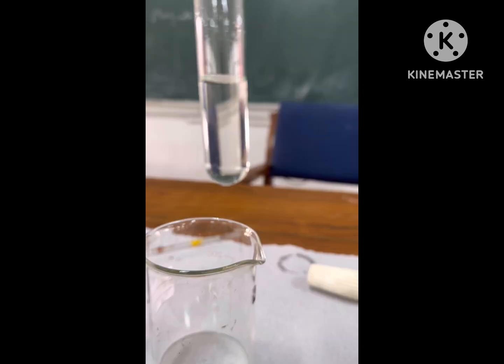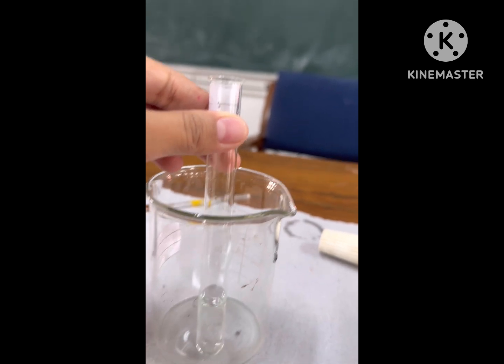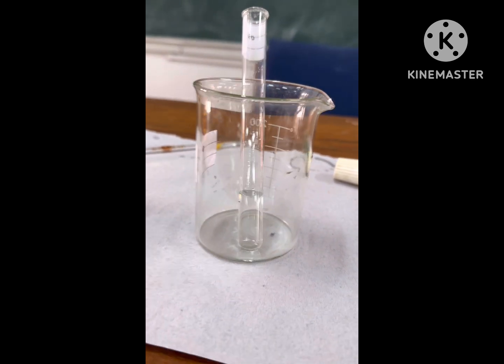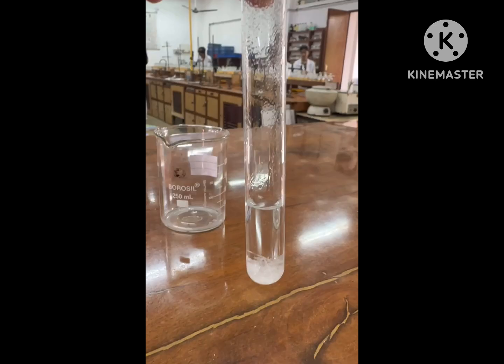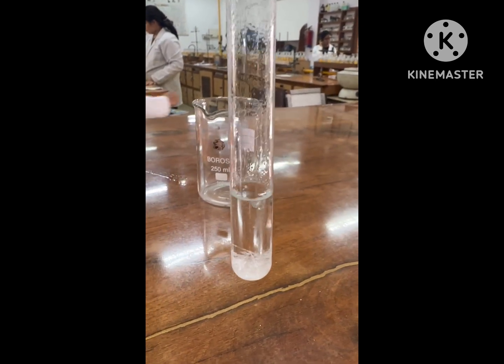This solution is now kept undisturbed for cooling and crystals to grow. After some time the crystals start forming. So here you can see needle-shaped crystals are formed.